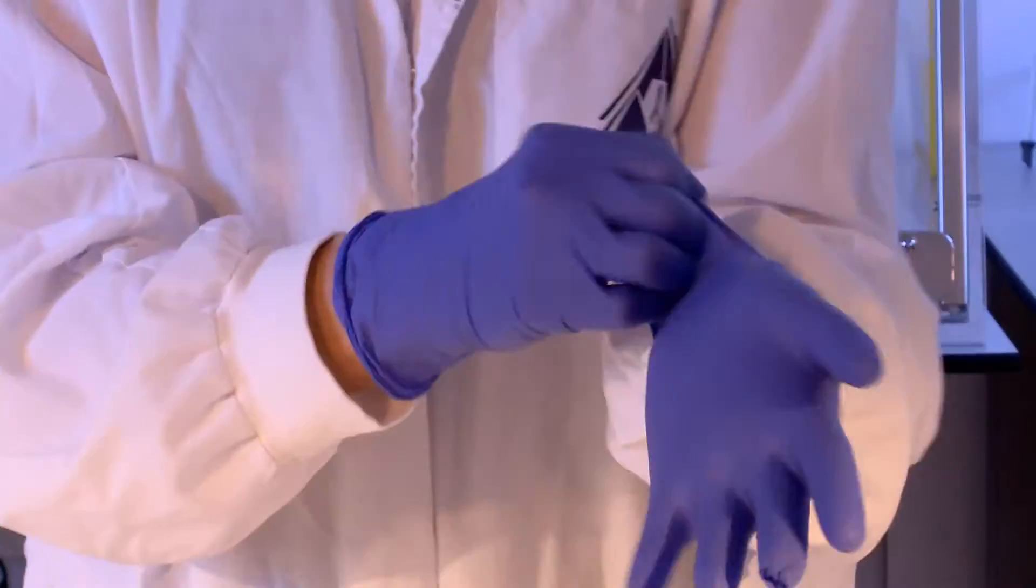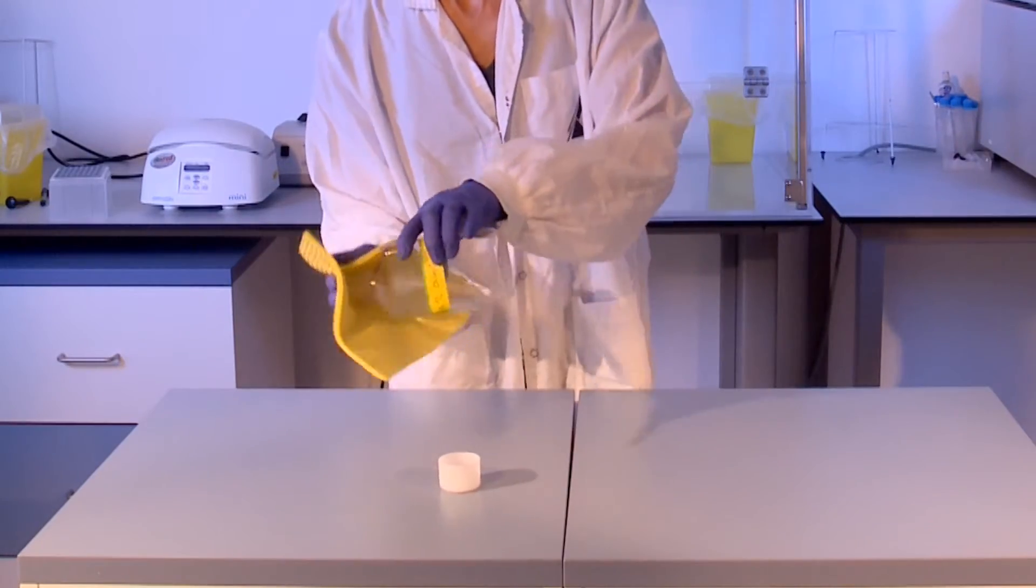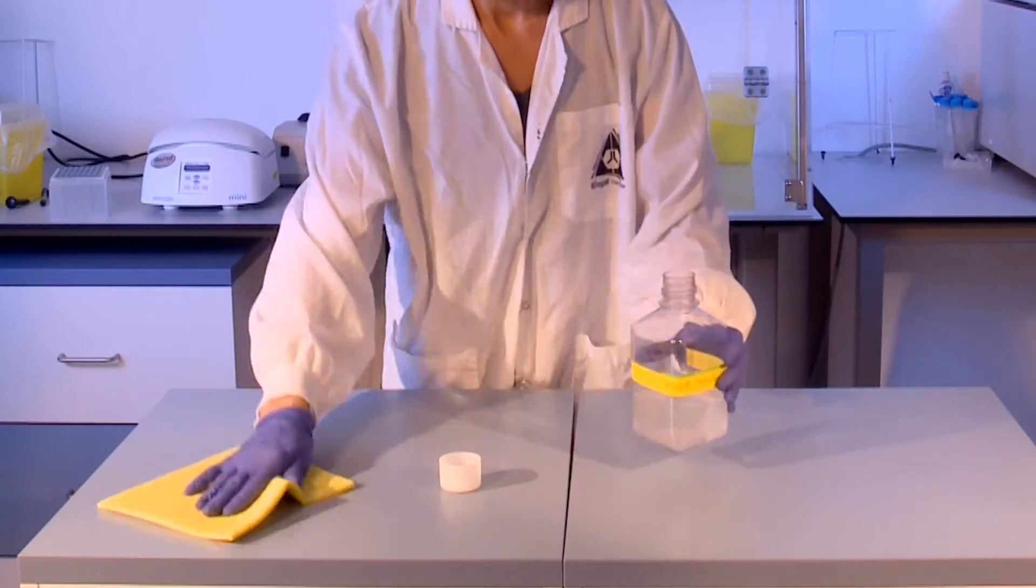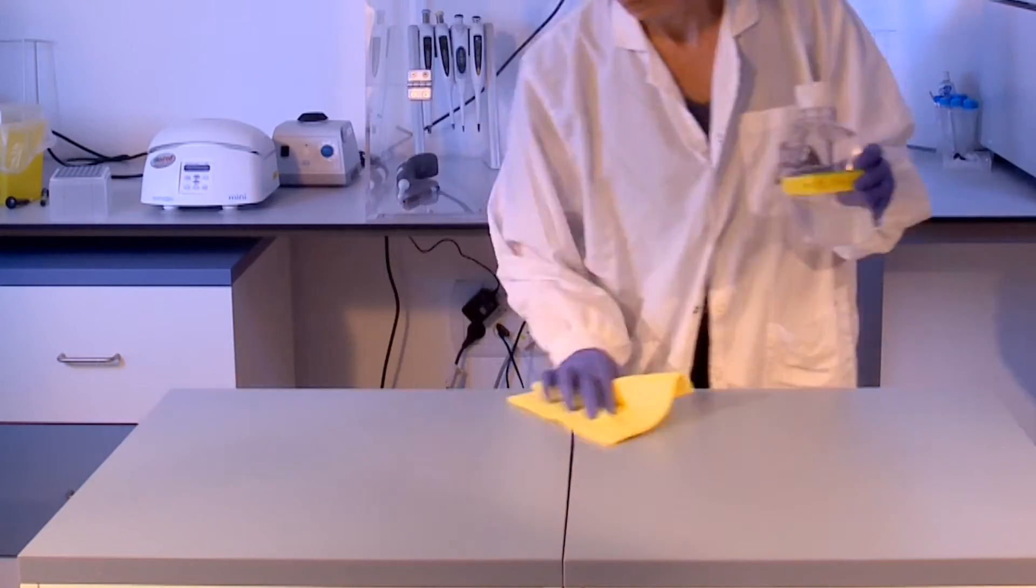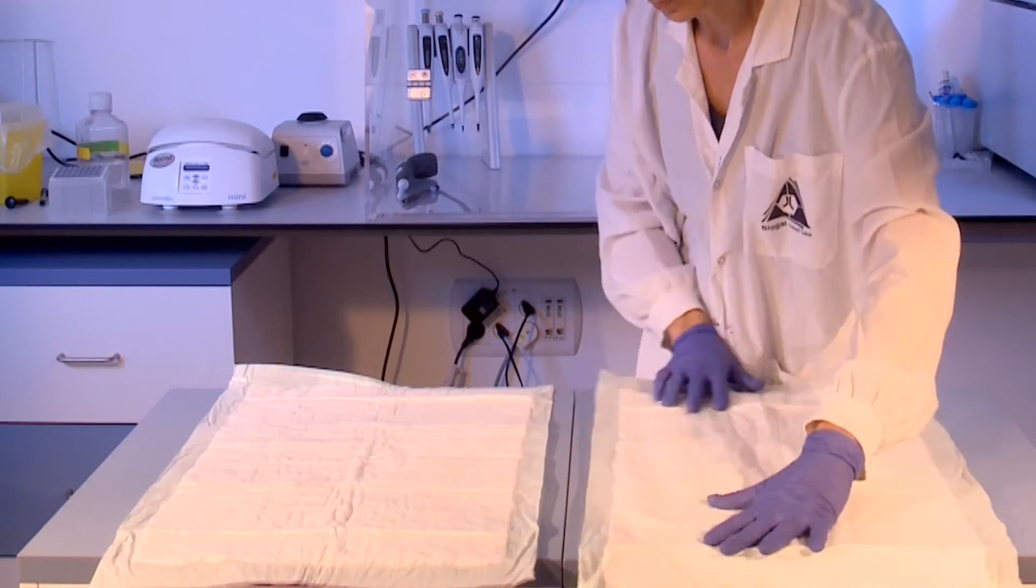Prior to performing the PC-RUN procedures, a suitable work area which has been decontaminated with diluted commercial household bleach must be prepared. Once the clean area is ready, you can begin with the DNA extraction step.